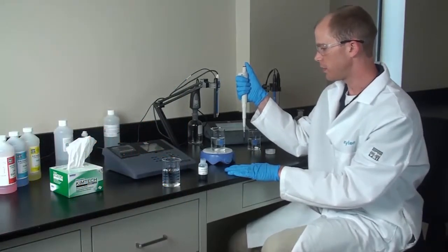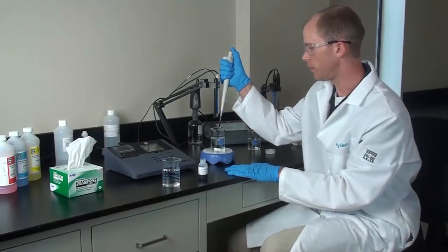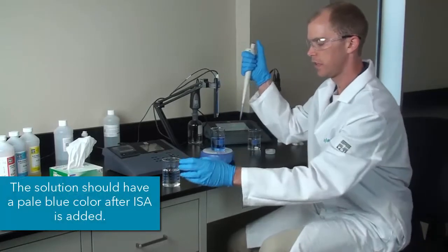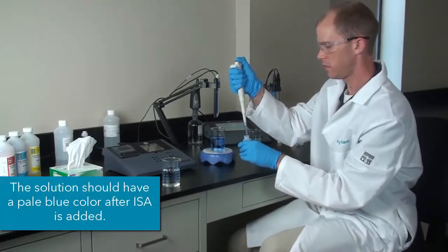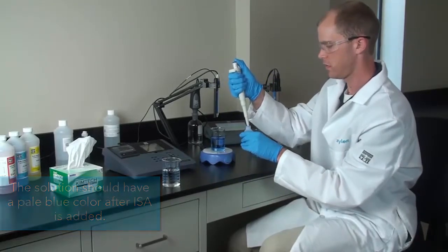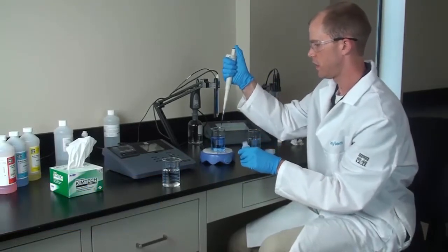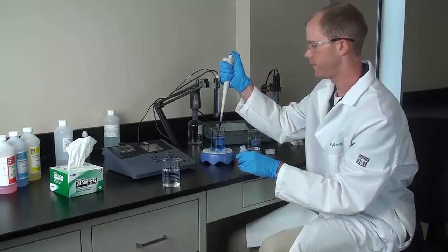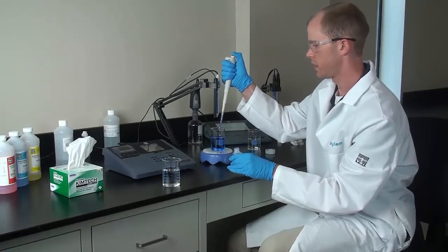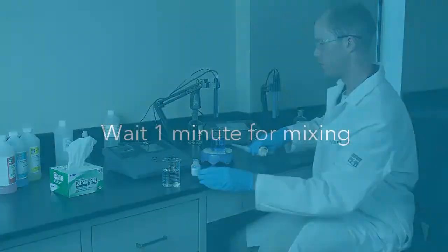So with the sample stirring, I will add my blue ISA. That is 1 ml. And there is 2. So we will let that mix for a minute.